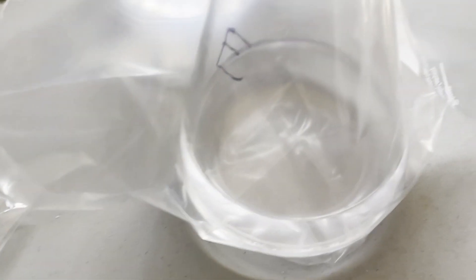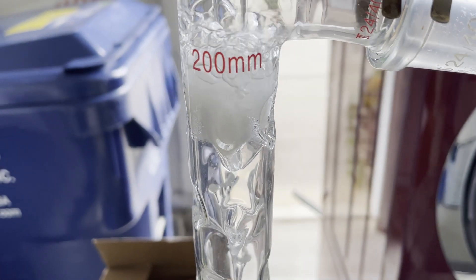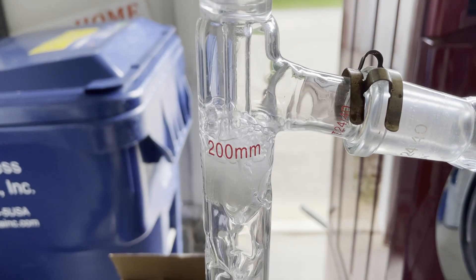So I asked around, and somebody told me to actually use a cotton plug in my fractionating column. So that's what I did, and it worked a charm.